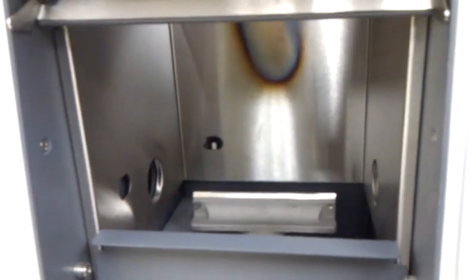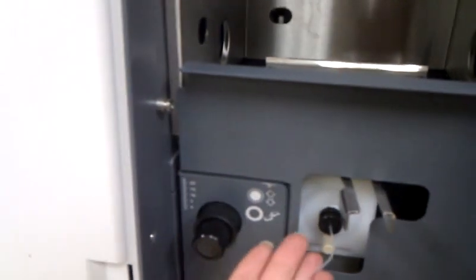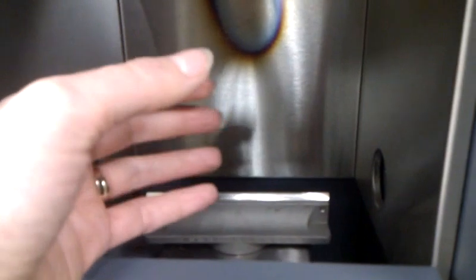When we have a flame going through here, a lamp of the chosen wavelength of the metal we're looking at is being shone across the flame. When a sample is aspirated into the flame and atomized, if these atoms can absorb radiation of that wavelength, then we will see that translated into a signal.